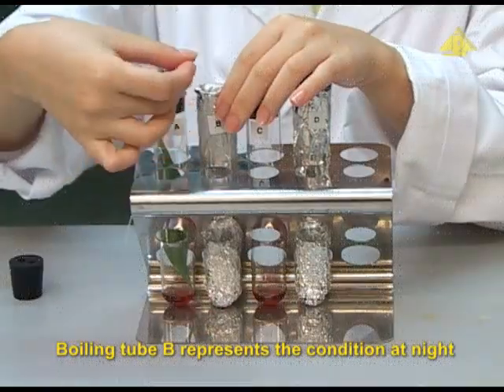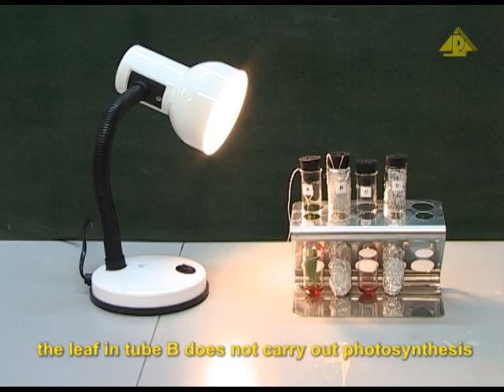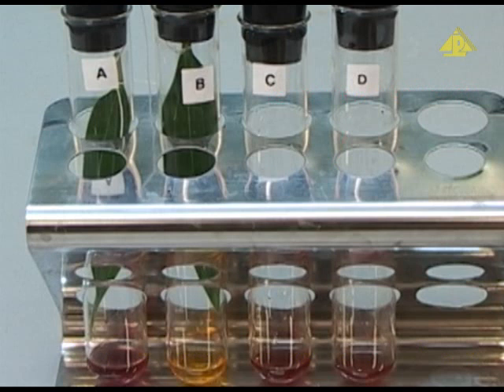Boiling tube B represents the condition at night. As light is blocked by the aluminium foil, the leaf in tube B does not carry out photosynthesis. It only carries out respiration. Carbon dioxide is given out and its concentration increases. As a result, the hydrogen carbonate indicator turns yellow.